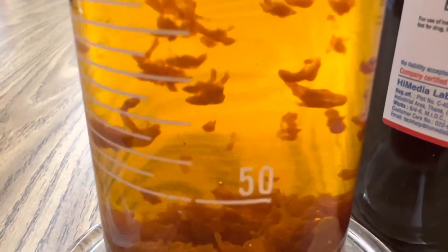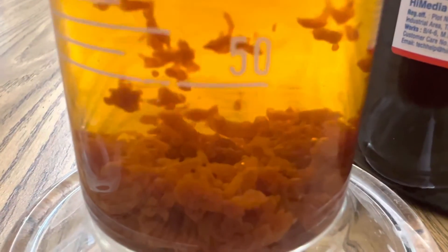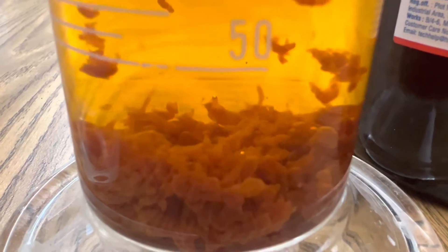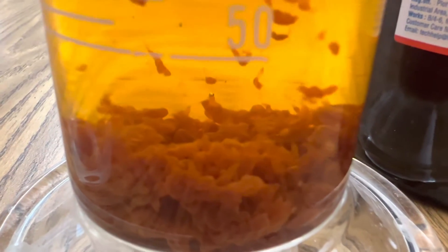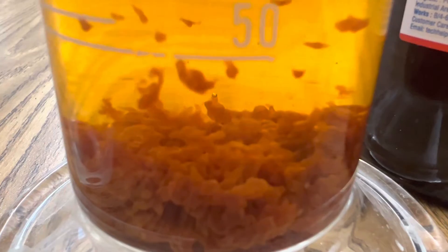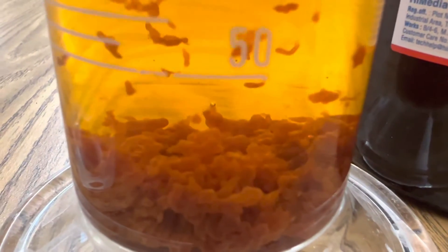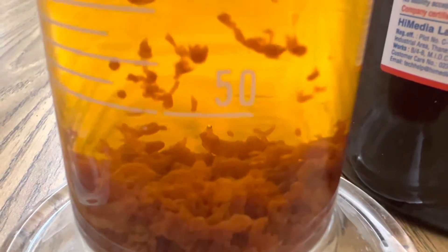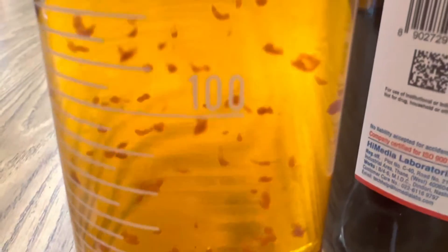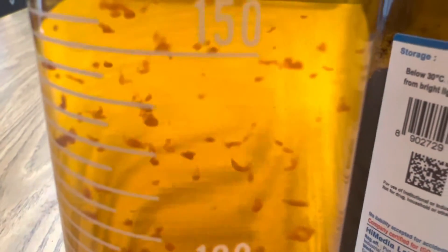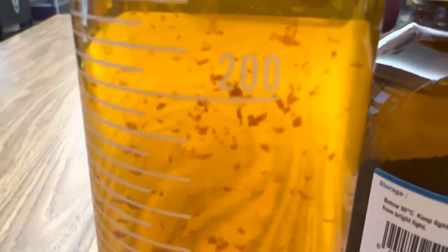Now, as you see that insoluble solid ferric hydroxide, just know that it's used for all kinds of things. It's used to treat anemia, iron deficiency in people, in the construction business. It's used to make bricks. It's used to treat water, to purify water, all kinds of uses for ferric hydroxide.